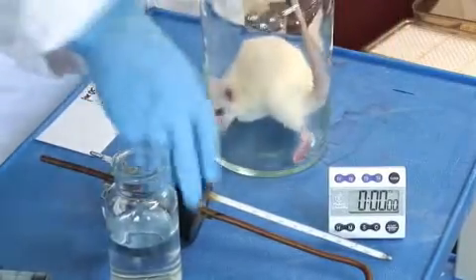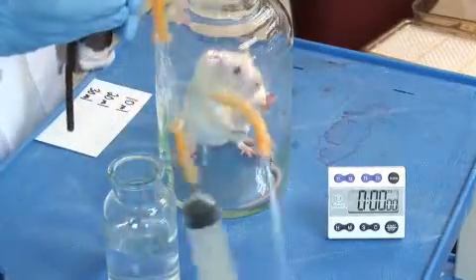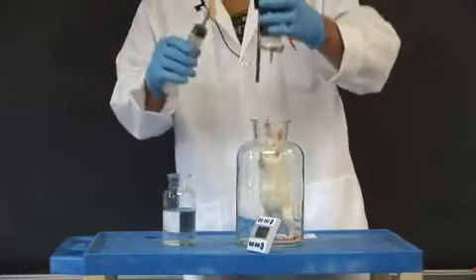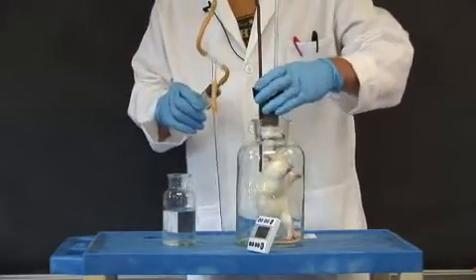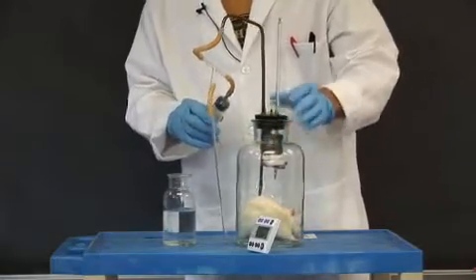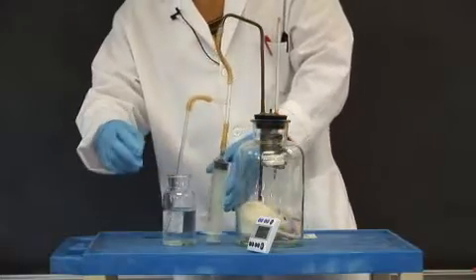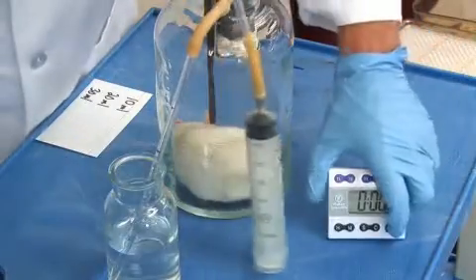Thank you. Get your tail in. Okay. So now we have the rat, and we start the timer.